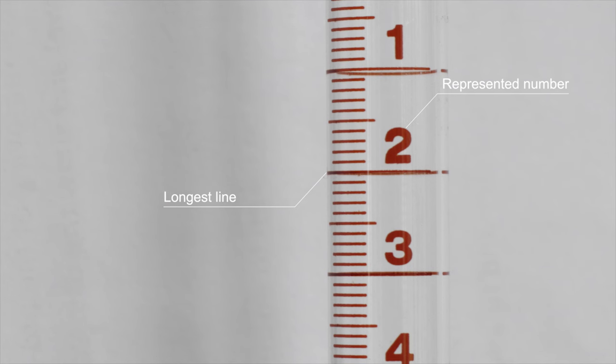The second type of line comes after the longest line, which represents an increase in volume of 0.1 milliliter. If we look at the burette, as we move down, the lines would represent 0.1, 0.2, 0.3, and 0.4 milliliters.